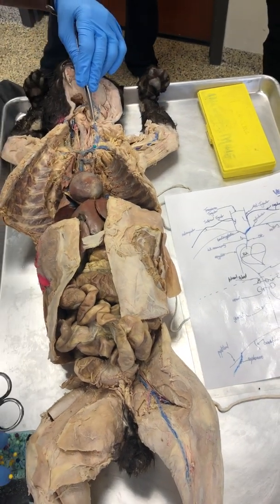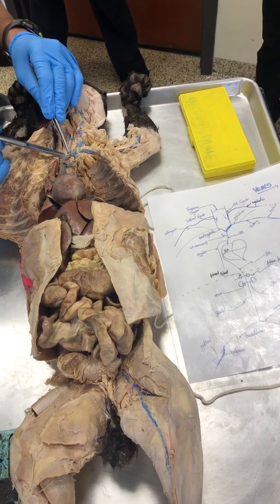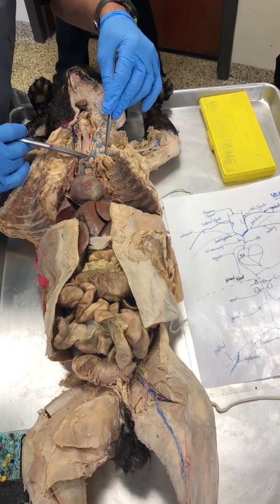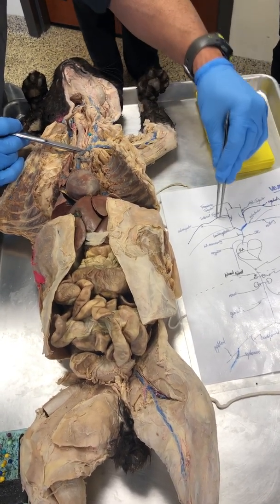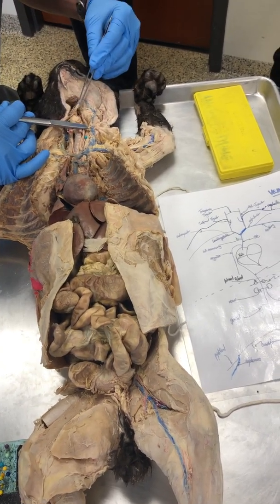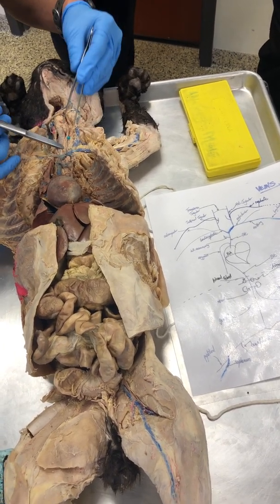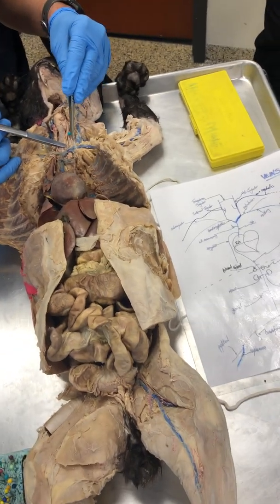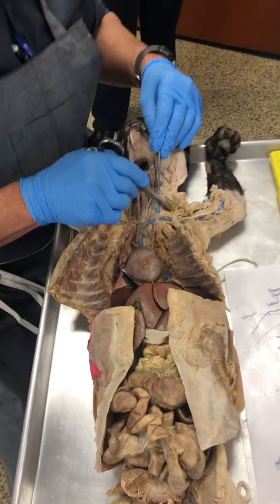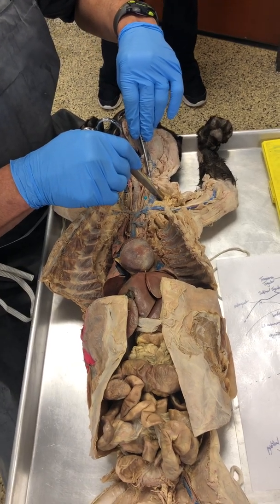So that, folks, is this branch. Notice there, brachiocephalic is the point of reference. Draining into it is this one. Notice I've not said any name. I said it came out of the upper limb. This one, the big one, is the external jugular. Crossing between the 2 external jugulars is the transverse jugular. The small one that comes up here is the internal jugular. And then on the other side, in a T-junction into the external jugular, is the cephalic. So that's that first branch.